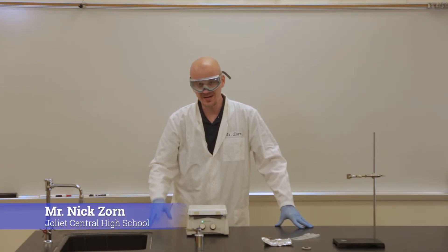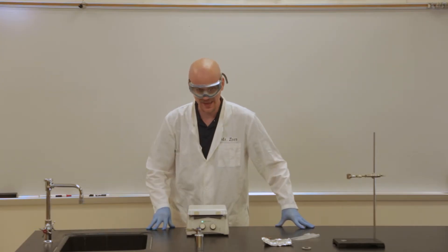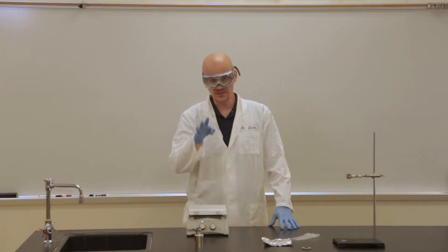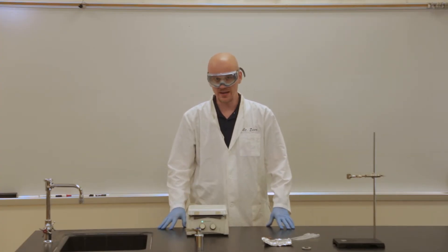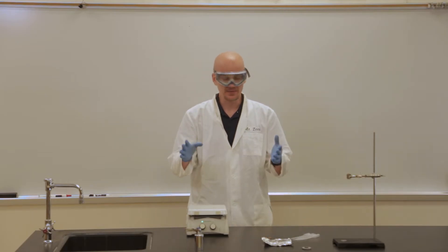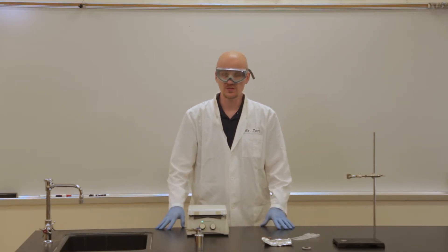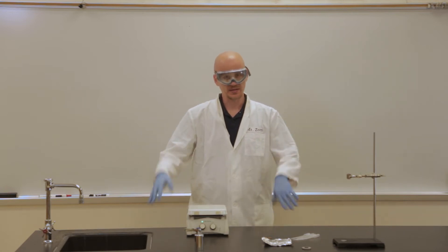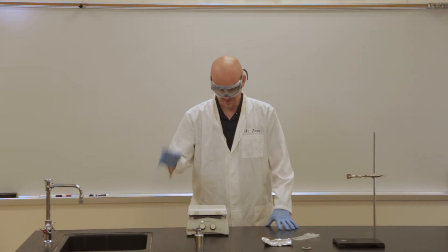Hello everybody, I'm Mr. Zorn and this is the Intermolecular Forces Lab. In this lab we're going to look at four substances and we are essentially going to rank the intermolecular forces. We're going to do a couple different tests to help us identify which of the four substances is the strongest and the weakest in terms of intermolecular forces.